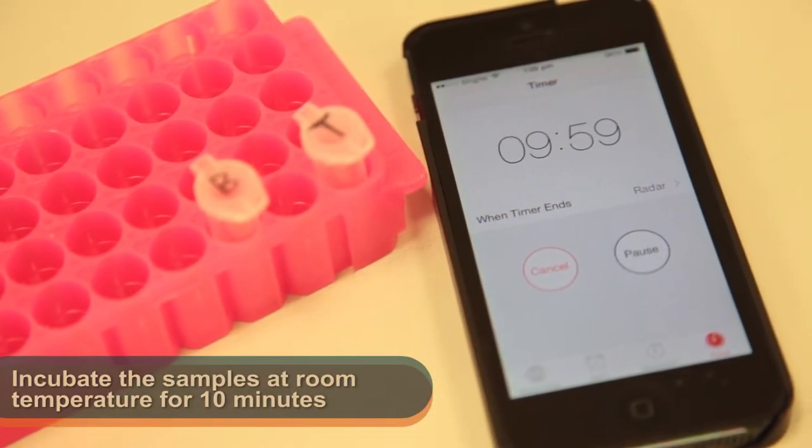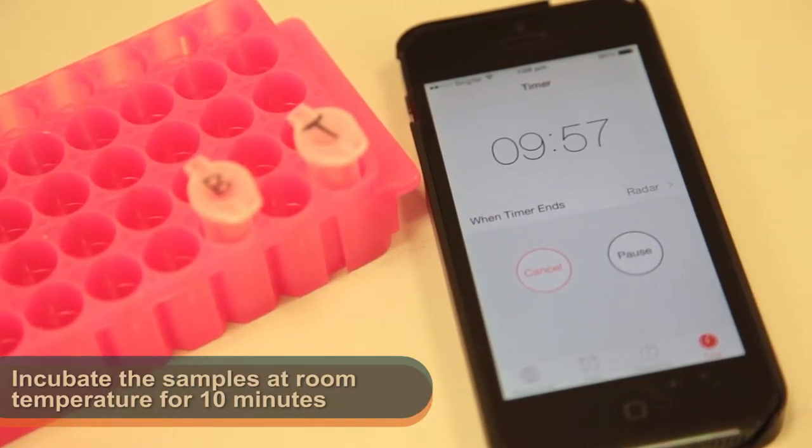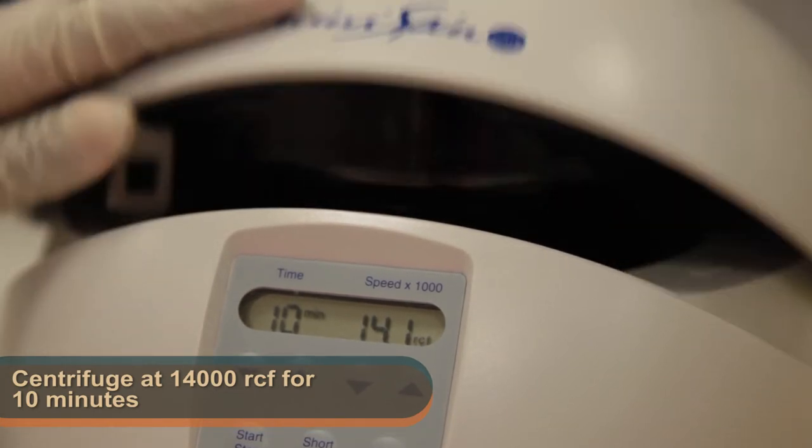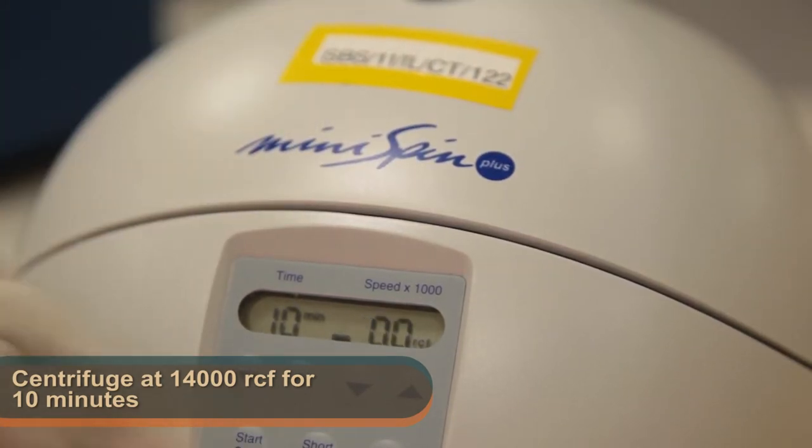Next, incubate the samples at room temperature for 10 minutes. After the incubation, centrifuge the sample at 14,000 RCF for 10 minutes.